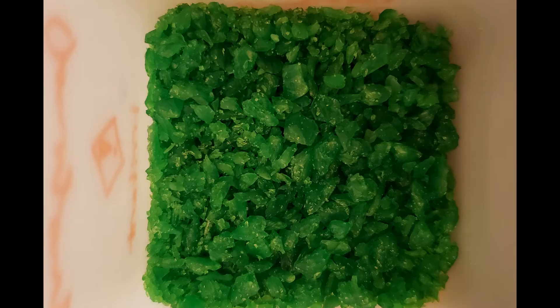We obtained 50.95 grams of light green trihydrate crystals, or about 84% yield.